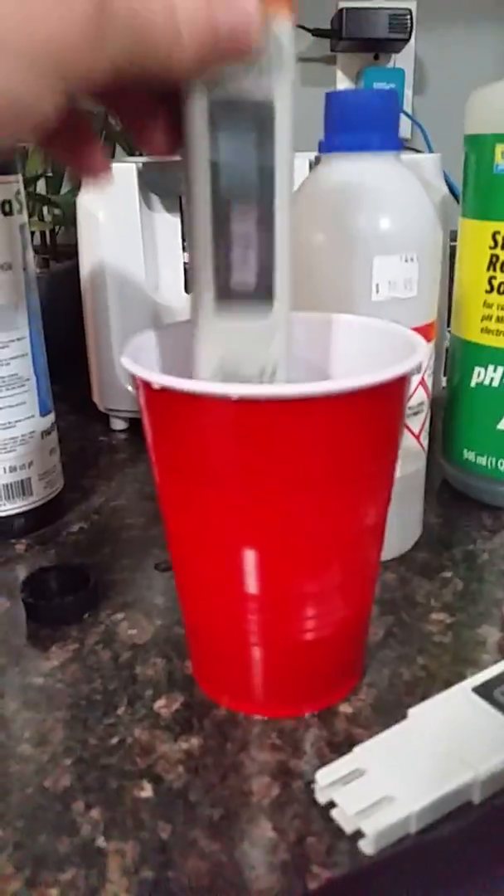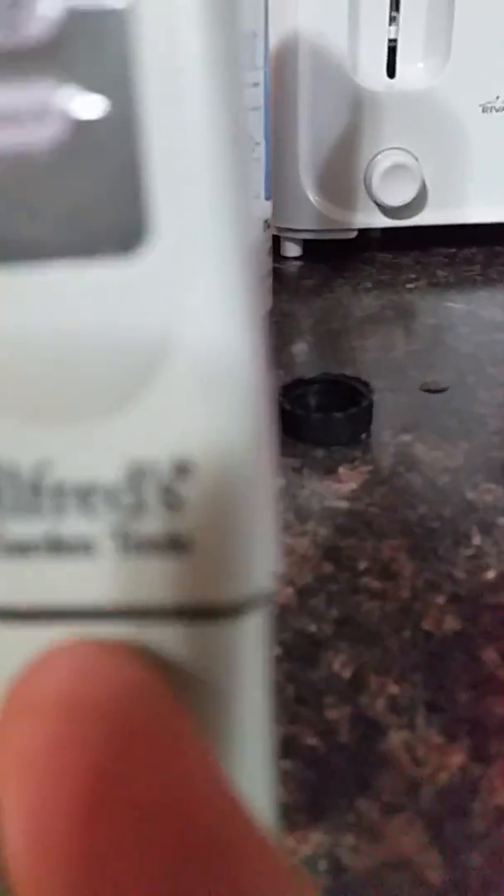What I always do is give them a little washing with water and make sure you've got these guys filled up with a bit of solution. Storage solution is like 4.0 — you stick them down, there's a little rubber on them, and you just let the water squirt out. Then put them away and keep them stored in it.